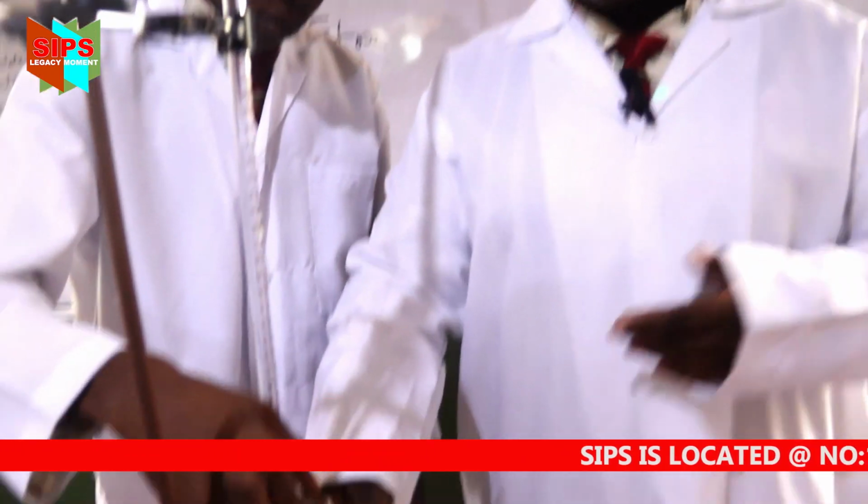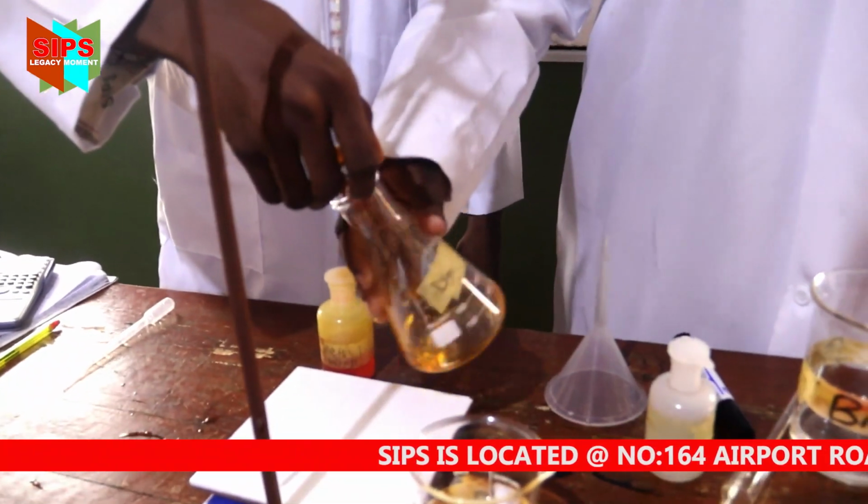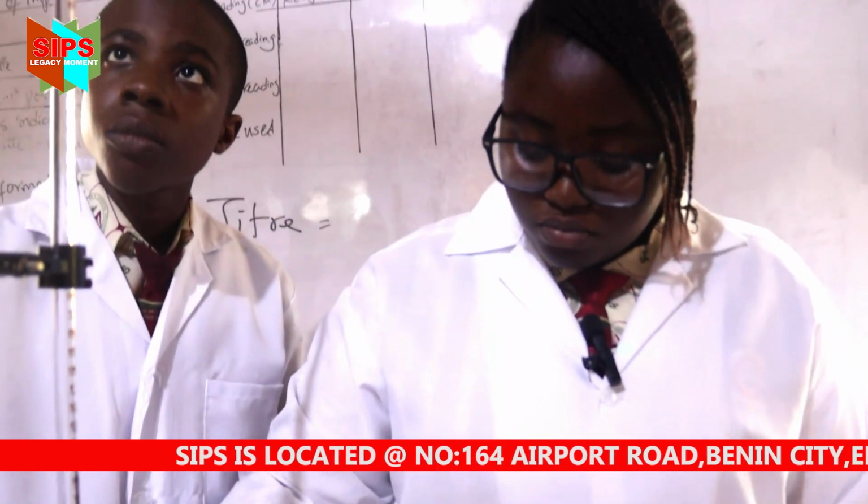Now we proceed by adding our acid into the solution while shaking vigorously.